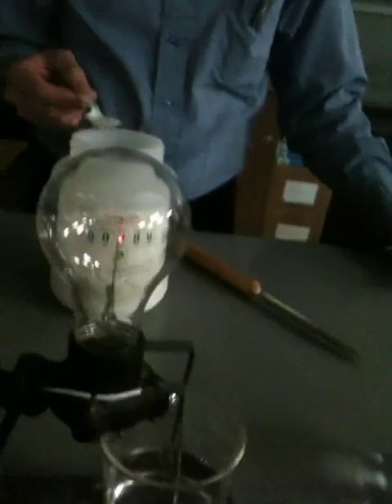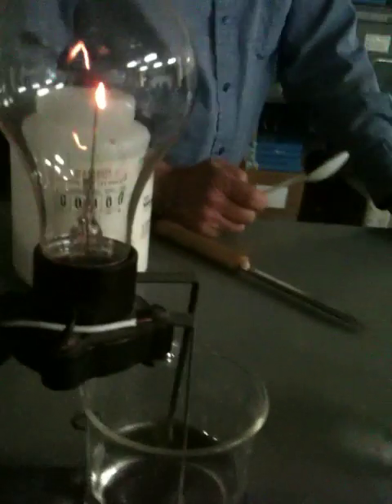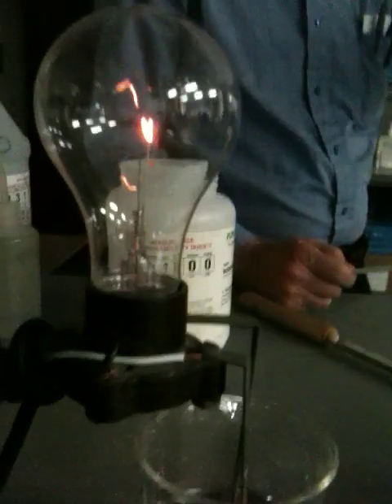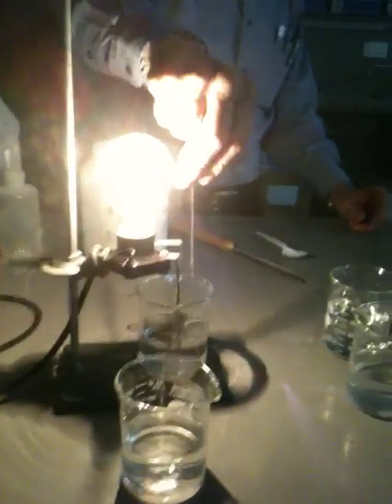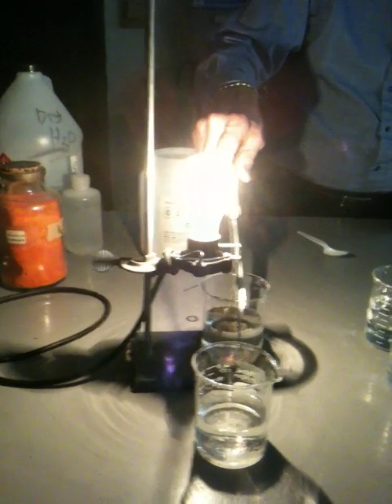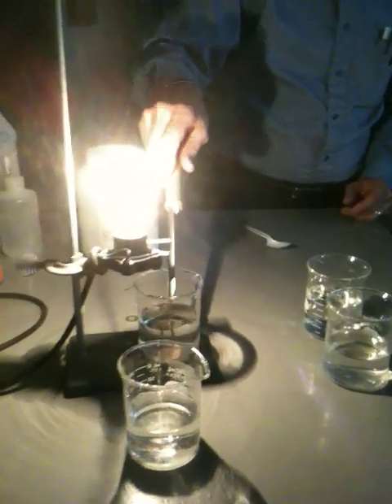You have to mix it? No, we don't. Are you seeing what's going on? There's a light coming on — look at that! It's getting brighter. What is happening to make that happen? It's dissolving — salt is dissolving. It doesn't need to be stirred. What does stirring do? It dissolves it quicker, because you're making motion and there are more collisions of the water against the crystals of the salt. It's not fully dissolved yet. Woo-hoo! See? It was there all the time. Bright light. Will it get brighter? That means that's as bright as it can go. So we're getting good conductivity through that water, just as if we had a piece of metal on there.